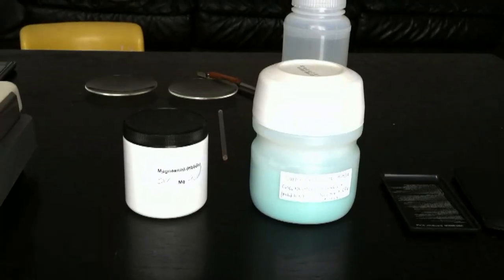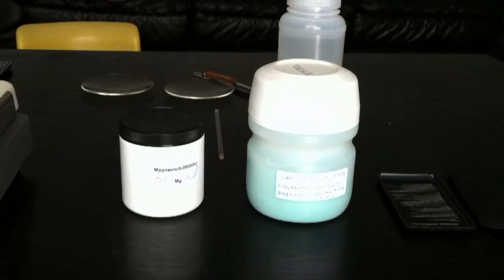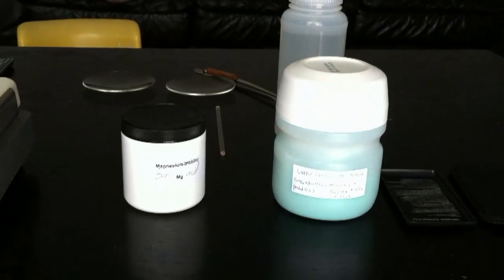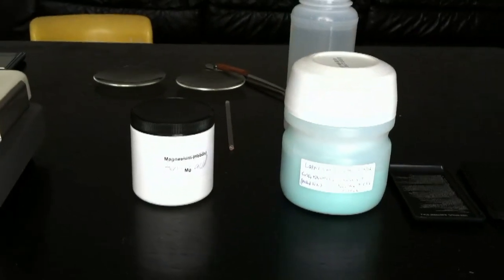For this experiment you will need copper 2 carbonate which we made in our first video. You will also need benzoic acid which we made in our last video.